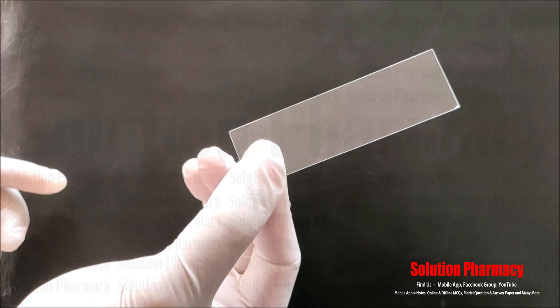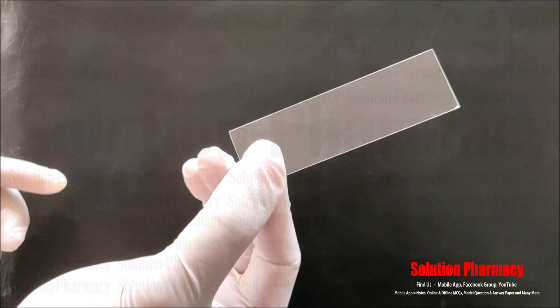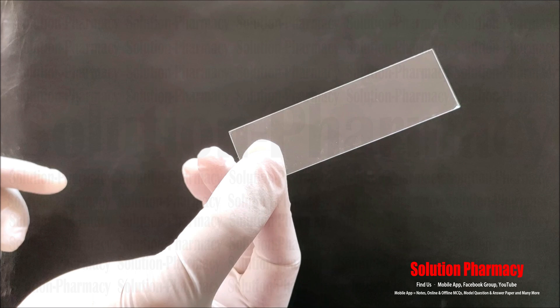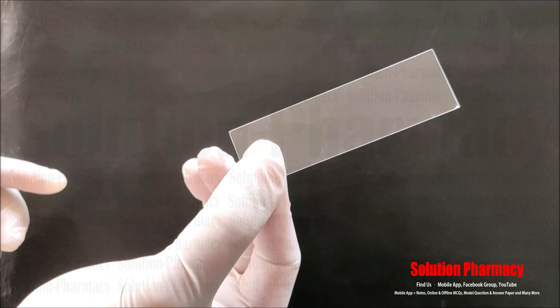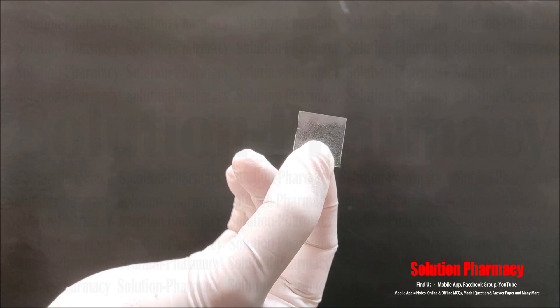The specimen means a sample of blood, or a sample of tissue for study under the microscope. We have to cut a thin section of the tissue of plants or animals and then put this specimen — the tissue section or blood sample — over this microscopic slide, and then observe under the microscope.